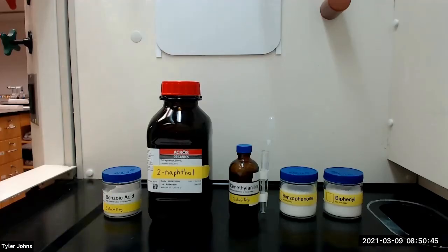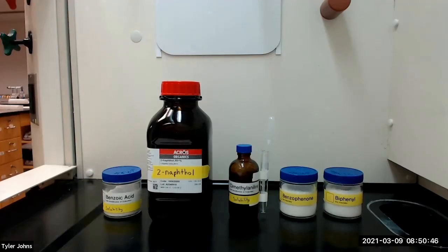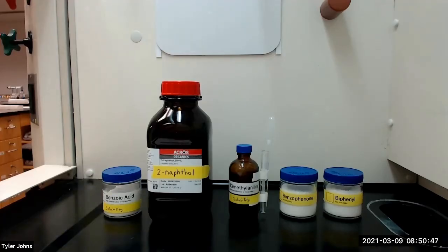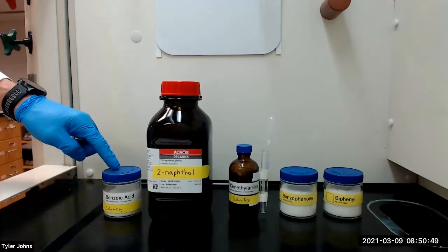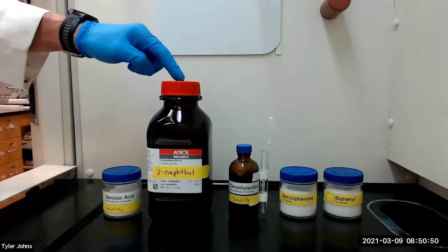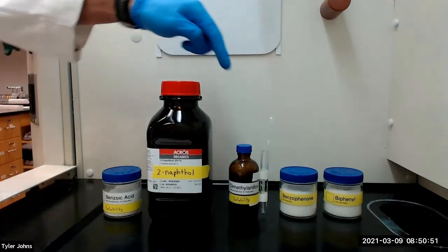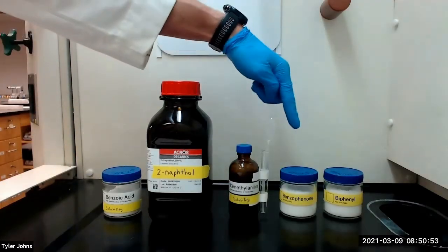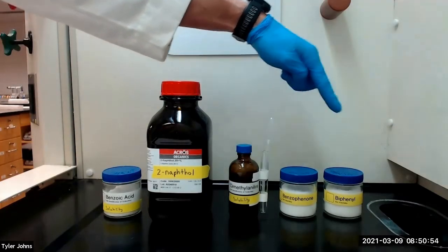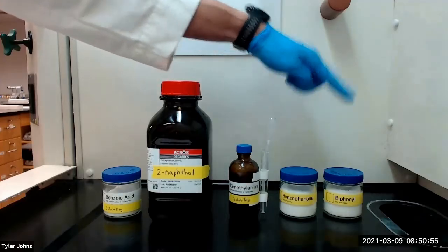We will practice the solubility test using five known compounds: benzoic acid, 2-naphthol, dimethyl aniline, benzophenone, and biphenyl.